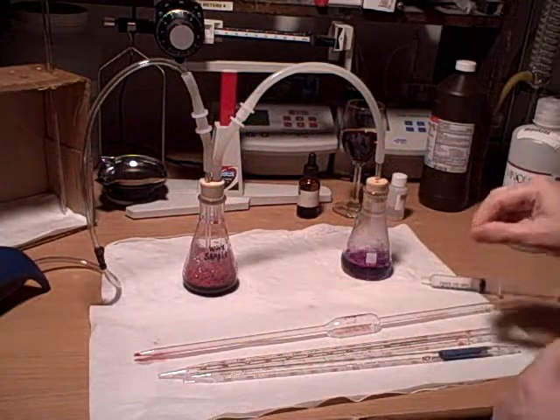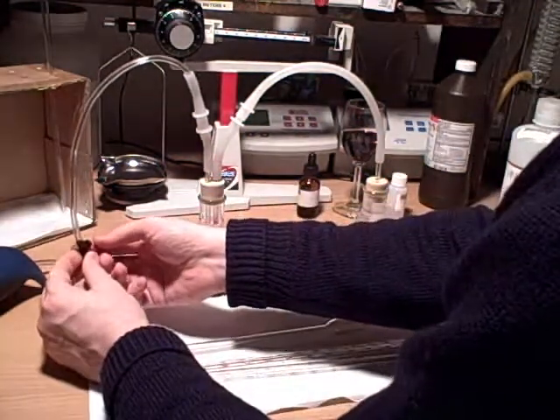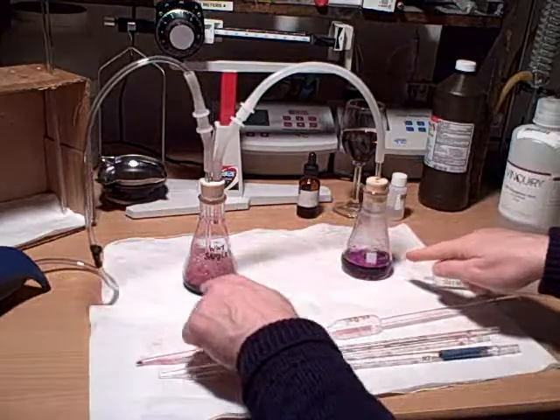Now that we've gone ahead and run our trial for about 15 minutes or so, let's go ahead and test it. We begin first by shutting off the pump, so I'm going to be screwing in the screw here. You can see that gas stops.